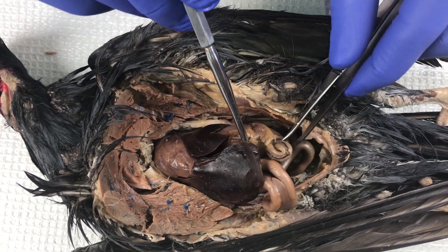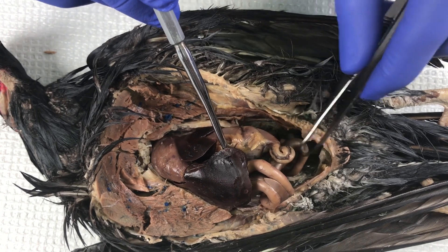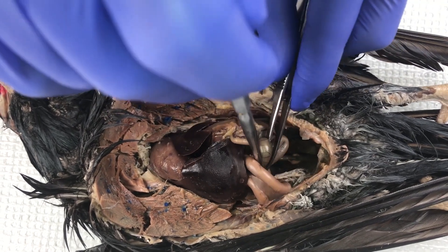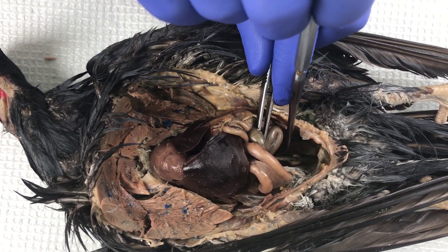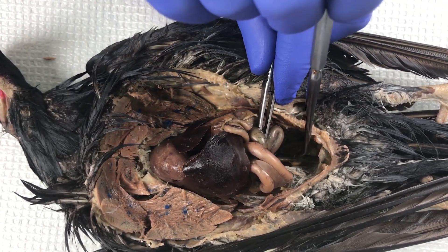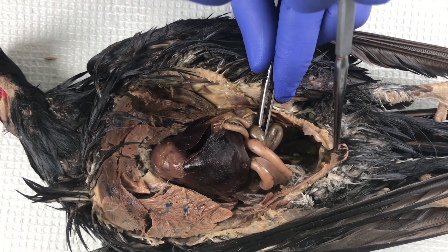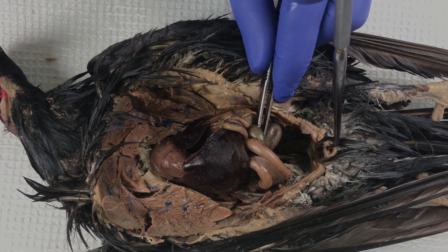Moving those small intestines out of the way, you can more clearly see the large intestine, the rectal ceca, and the colon, the contents of which empty through the cloaca.